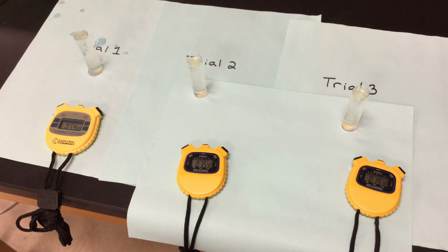So all of my yeast discs are on the bottom, hopefully working upon that hydrogen peroxide, which is the substrate, the catalase, which is in my yeast. My yeast is producing it because the yeast is a living organism. That's the enzyme that's going to work upon the substrate. And the products that it's trying to form is oxygen, which is going to trap to my little discs. And you see the one there in the middle that's trying to jump around. The one on the end is trying to jump around. And that oxygen that gets trapped on the disc is going to bring the disc back up to the top. And that's how we can see how quickly this reaction is working.